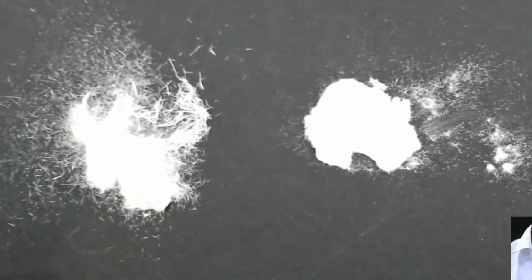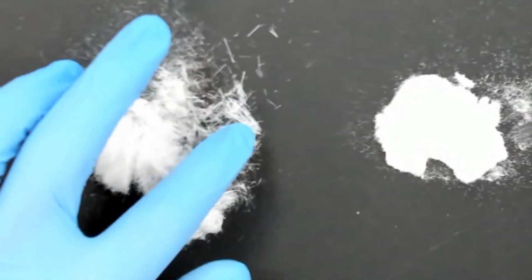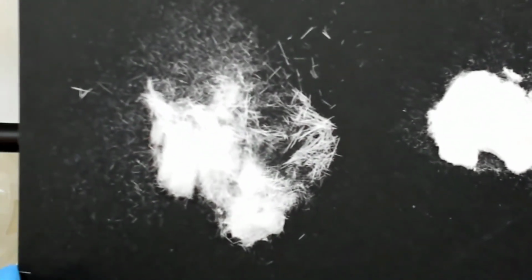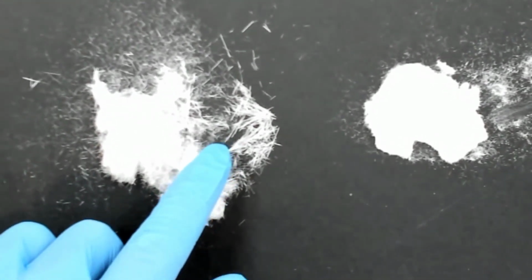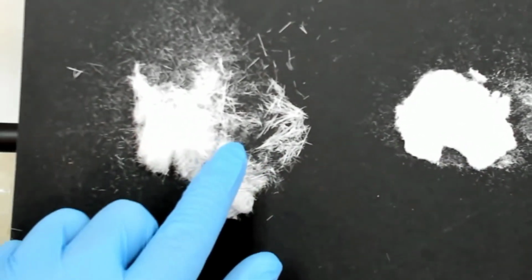Okay, so you take this picture and then you discuss in your lab report why this one on the right is clumpy, not like a needle form, but on the left here it is like a needle form. It's difficult to see from this because of the light, but anyway, this is a needle form. This is not like a needle, it's like a small needle only. But this is a long needle.